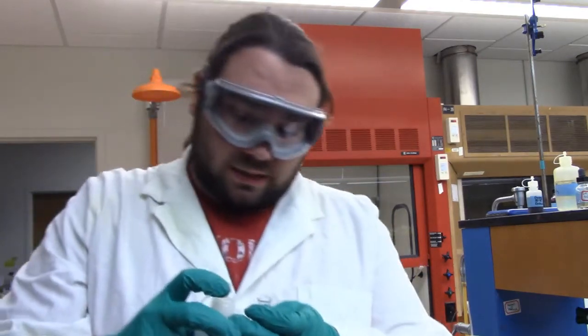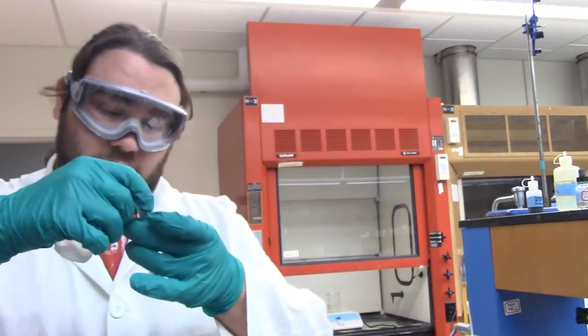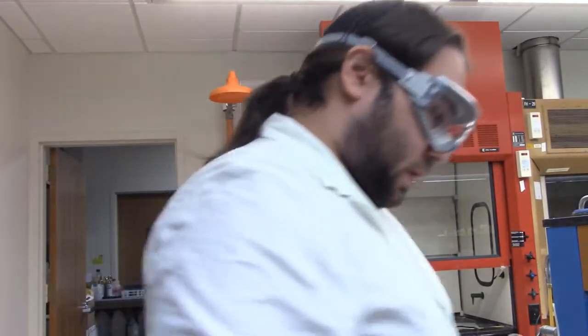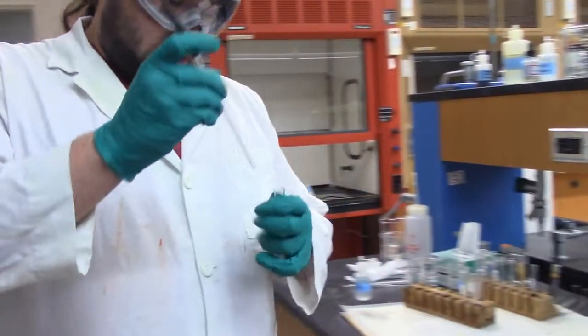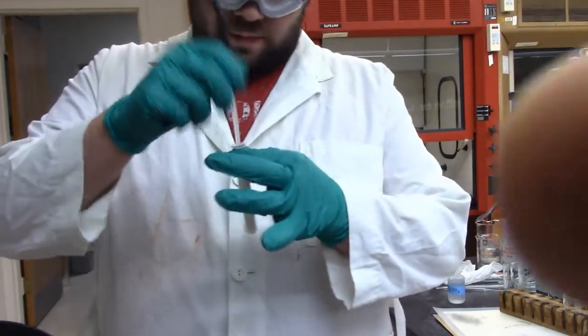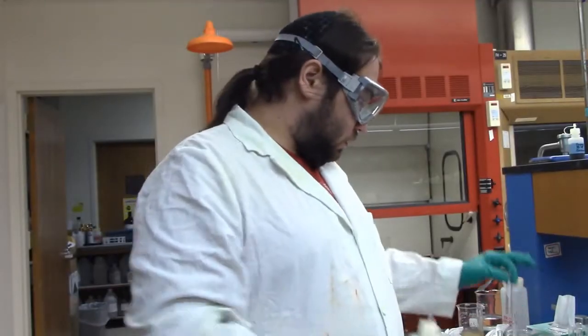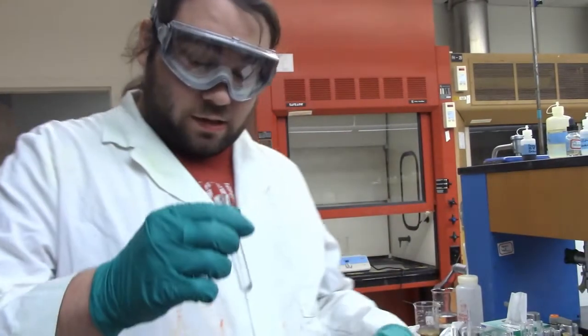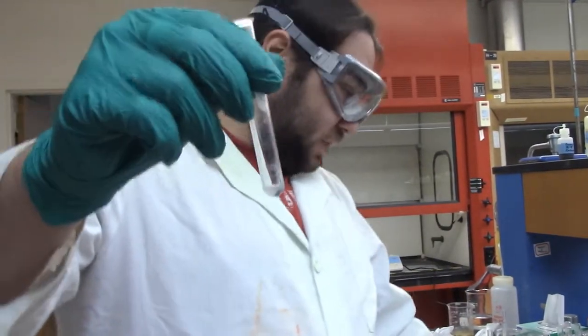So there's clearly something going on there. We've made a nice white cloudy solution, and we're going to mix thoroughly and centrifuge it. Then I might do a next step or two off camera, and I'll come back when I'm ready to do some barium stuff. Alright, so I did the washing and the centrifuging, and here we have a precipitate going into step 14, which is kind of a gray color.